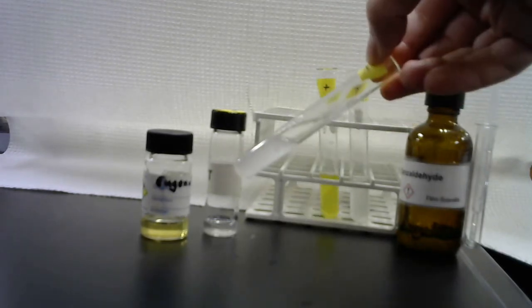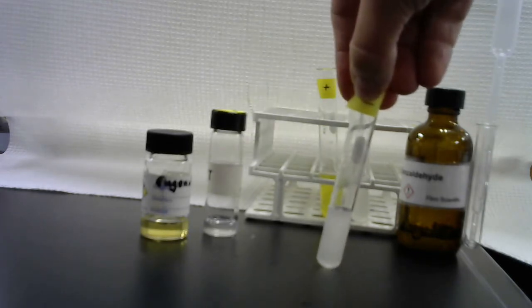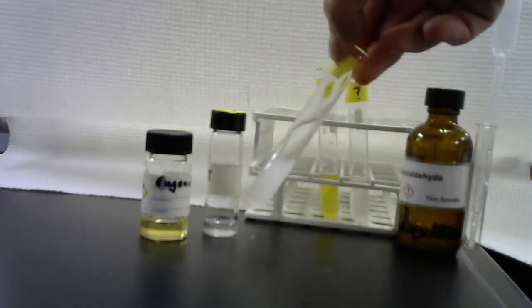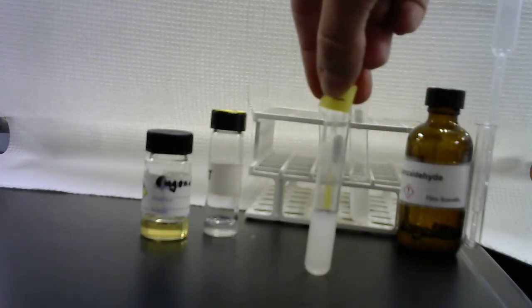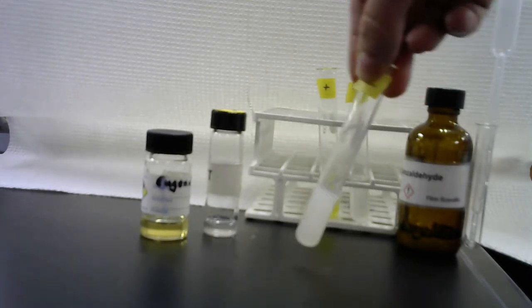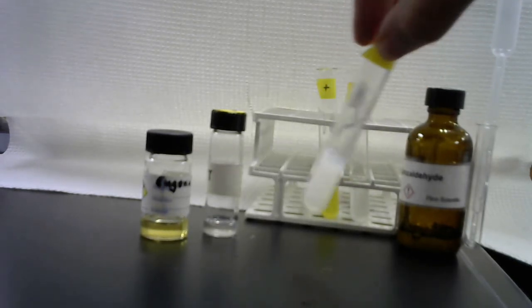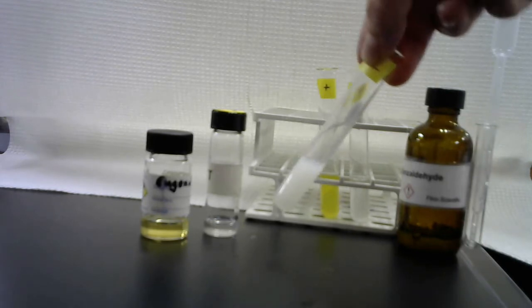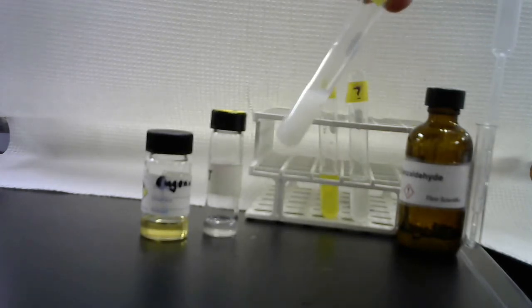Here's the benzaldehyde. Benzaldehyde also sinks. But that cloudiness is another indicator that it's not soluble. If you have something that's soluble, it'll be transparent. This benzaldehyde was kind of oxidized. It's got a lot of benzoic acid in it, and so that might act kind of as a detergent and make it look funny like that. But definitely, this is not just nicely dissolving into one phase.